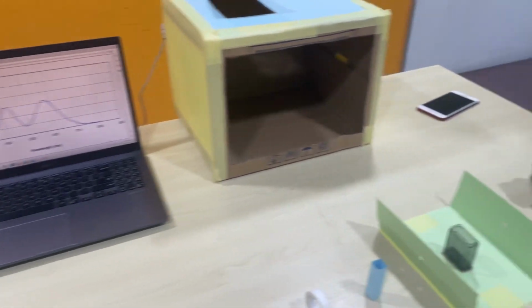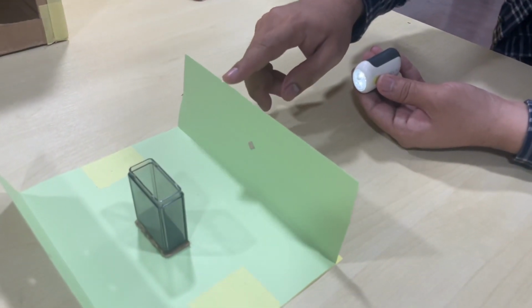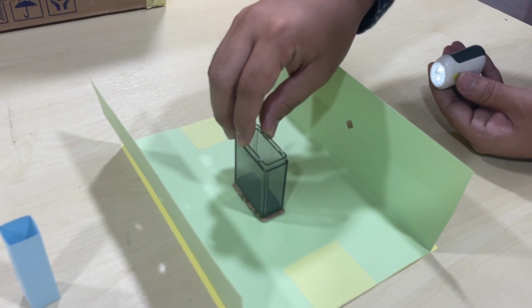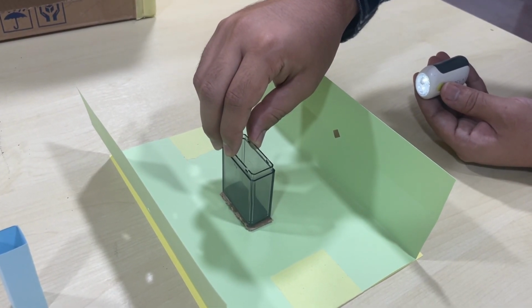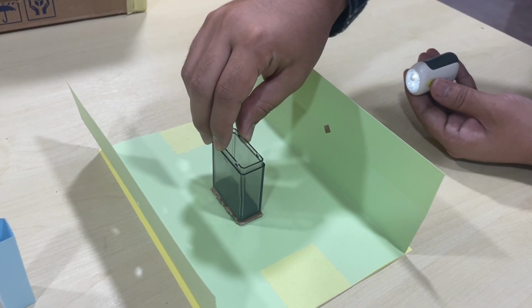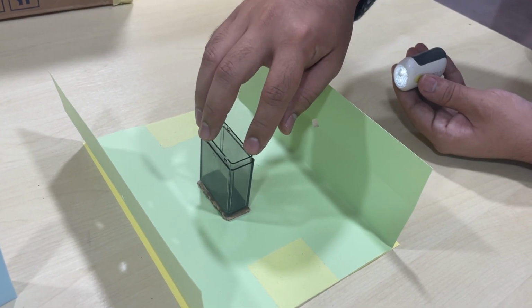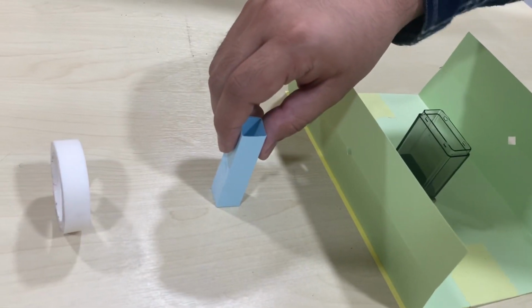The light source will pass through the entrance slit of the monochromator, and then will pass through the prism that only selects one single wavelength. We can preset it, like a 525 nanometer wavelength, and it only produces 525 nanometer wavelength out of the exit slit into the sample cell.